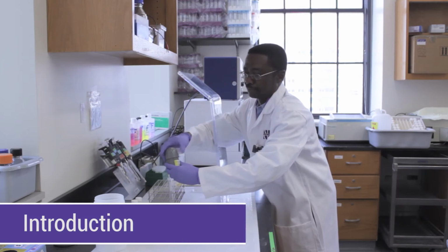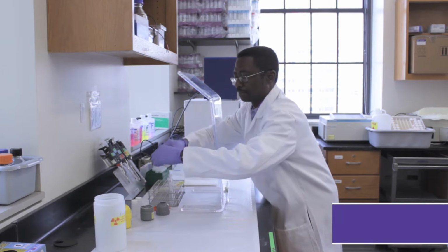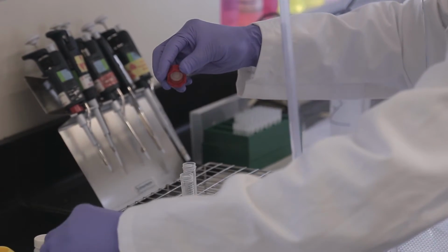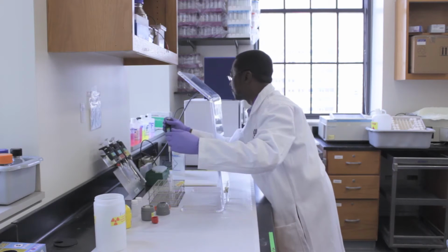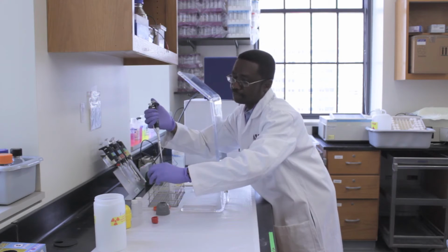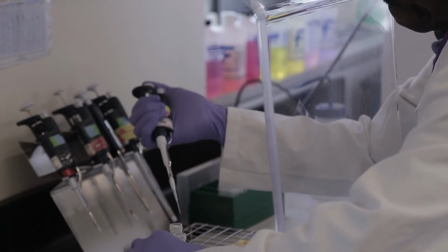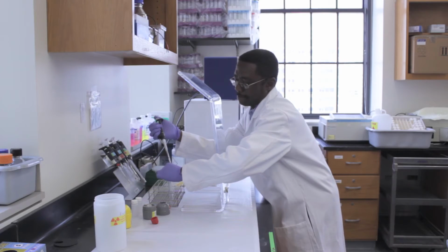Northwestern University has cradle-to-grave responsibility for hazardous waste. This means that radiation workers are responsible for proper management of radioactive waste, from its generation in the lab to its proper disposal. In addition, Illinois regulations require that waste containing hazardous, biological, pathogenic, or infectious material be treated to minimize the potential hazard to personnel and the environment.